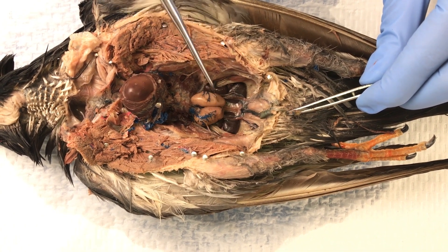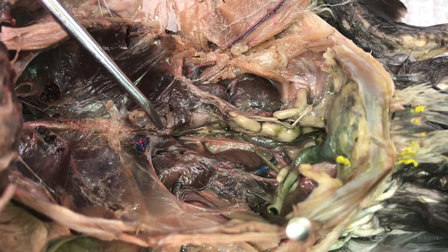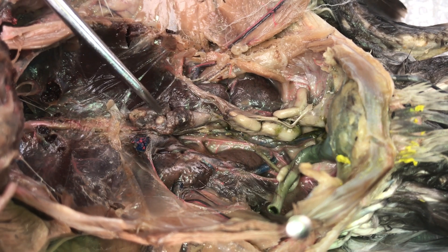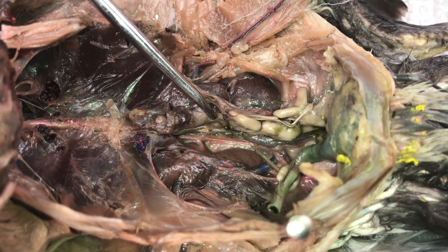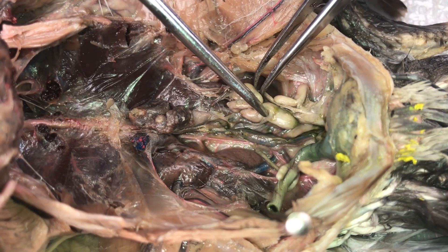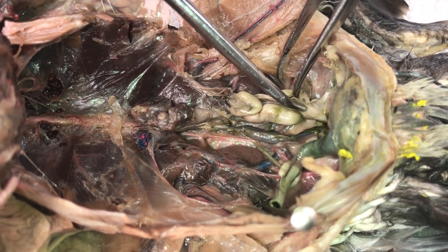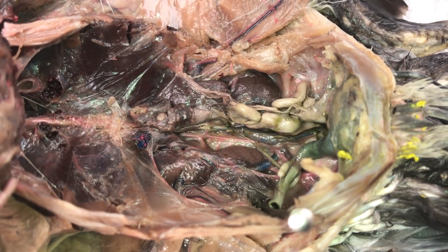If we look at the female, you can see the ovary with eggs in different stages of development. You can see the oviduct leading down, and this exits through the cloaca. Females only have their left ovary and oviduct.